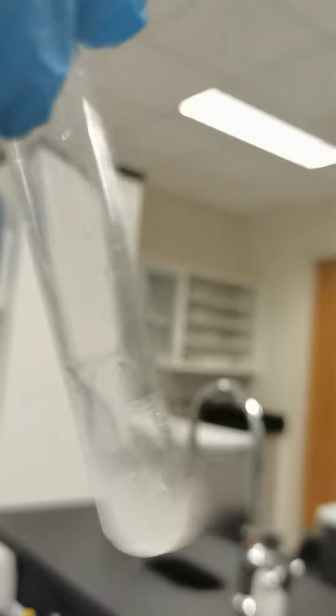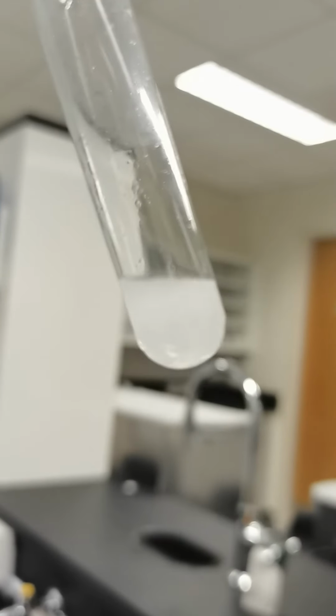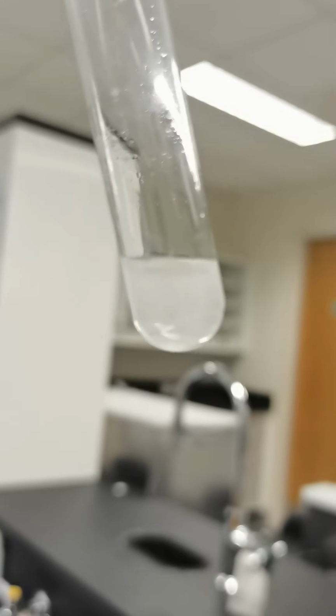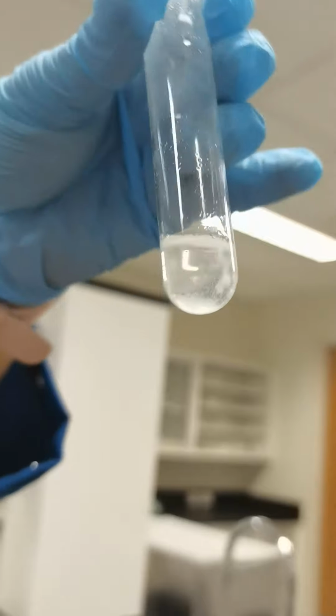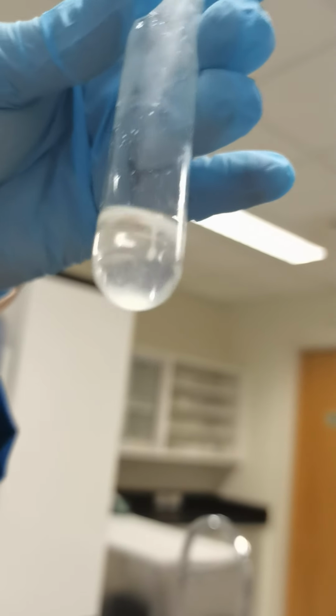Mixing it up, so it reacts fast. Almost finished. Yeah, almost finished now. Everything is clear.